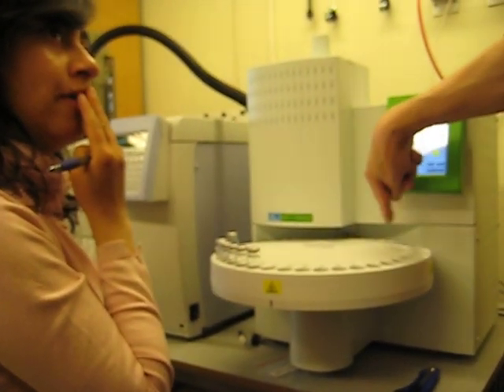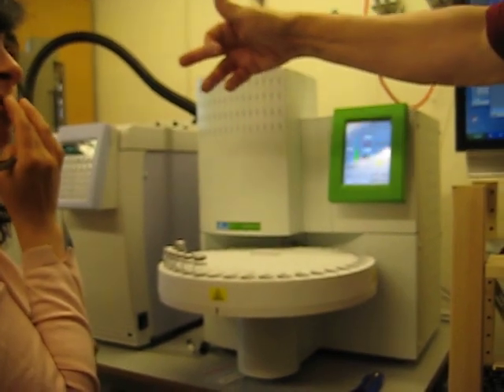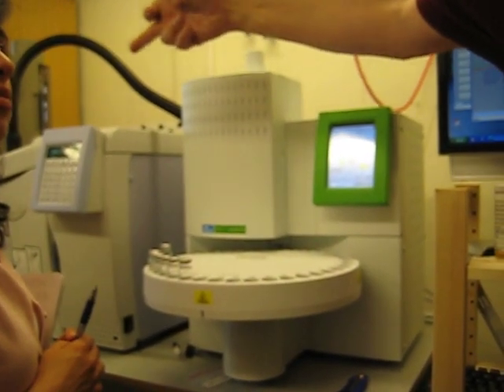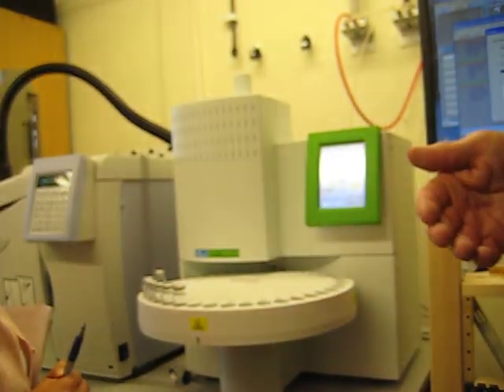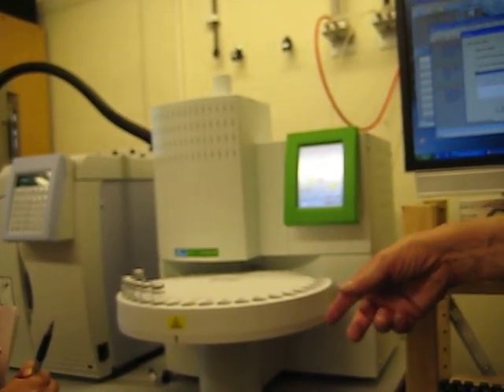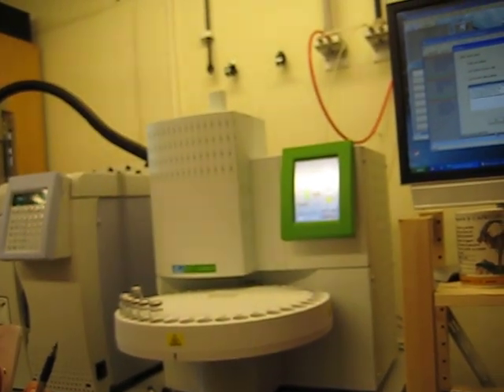You mean 40 samples? Yes. Yes, I can imagine. But then the thing that will affect it will be how long a GC run takes from the injection until all peaks have come through. And you can divide, you say 2 hours by 40? Yes. Approximately like 3 minutes per run?